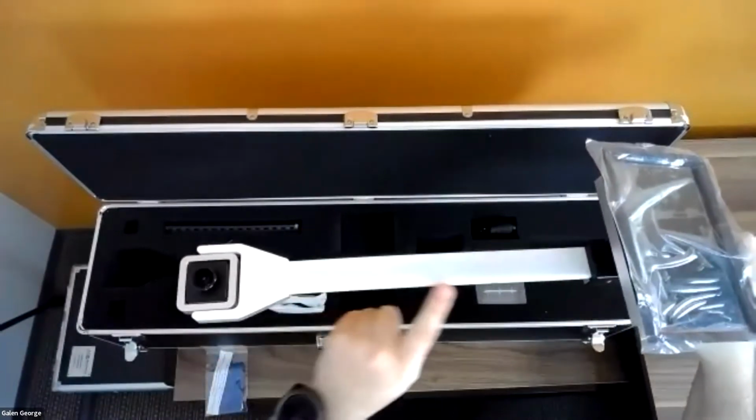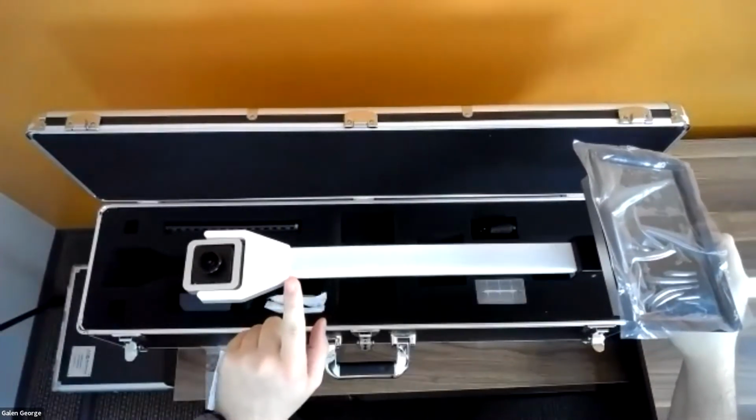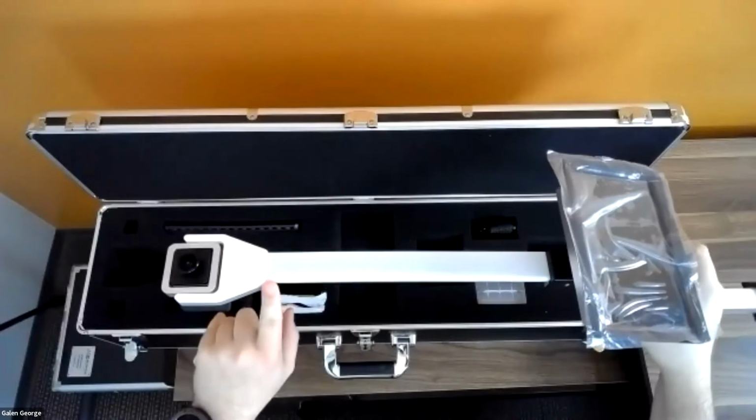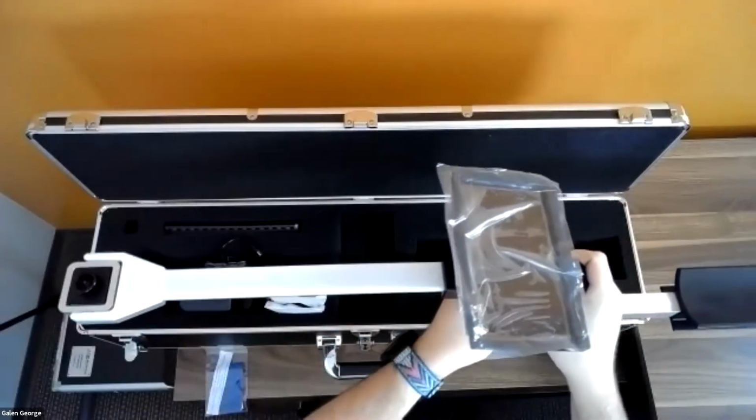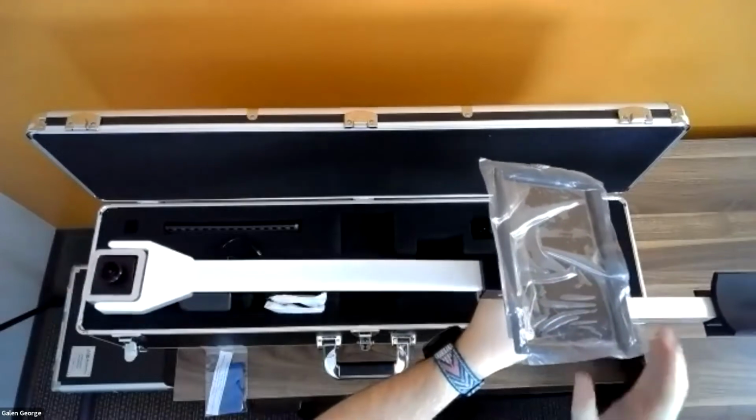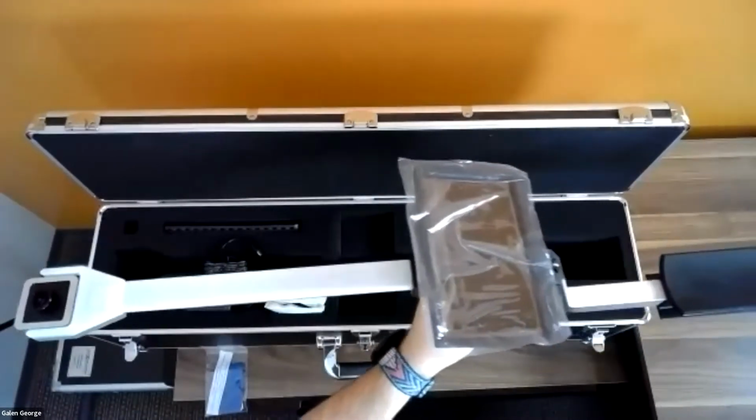Along this arm here, you can see it's all white on the top here. This is all lined with PAR sensors. There's 24 different PAR sensors in here. And those are going to be measuring the photosynthetically active radiation from 400 to 700 nanometers.